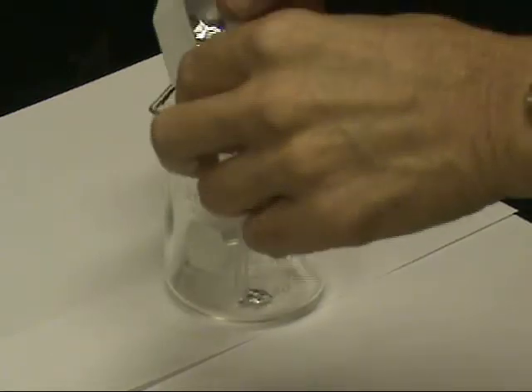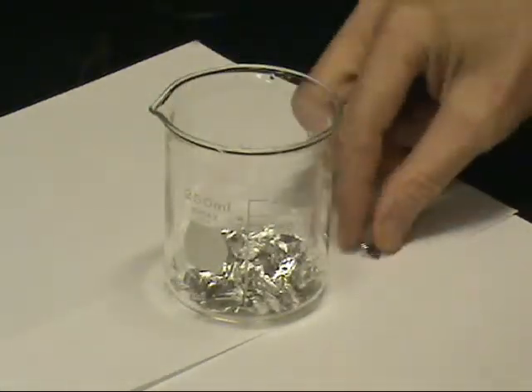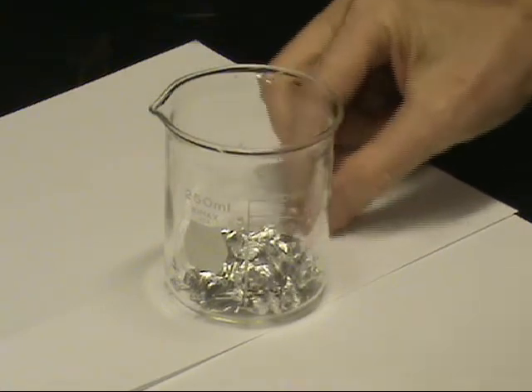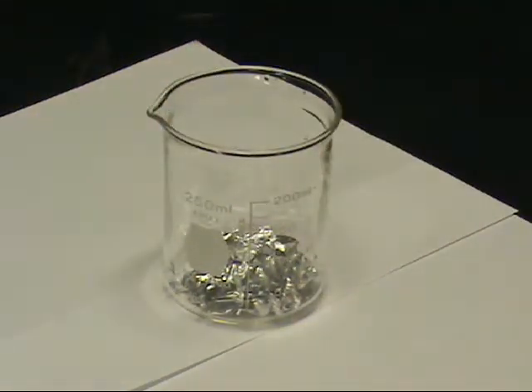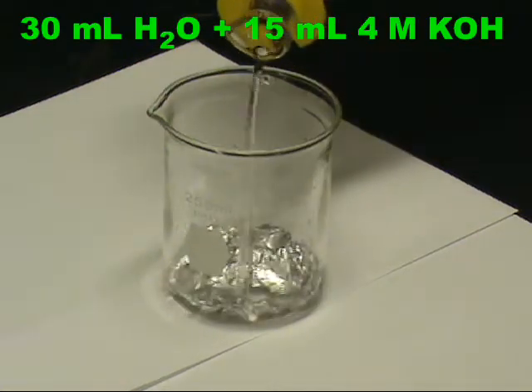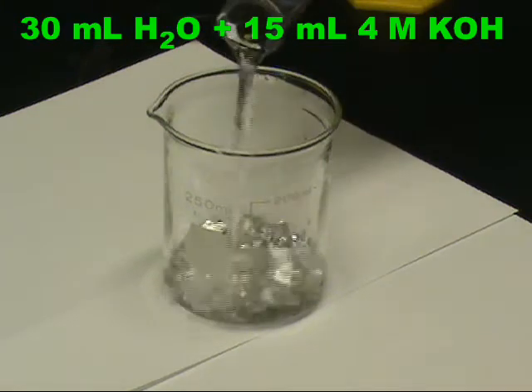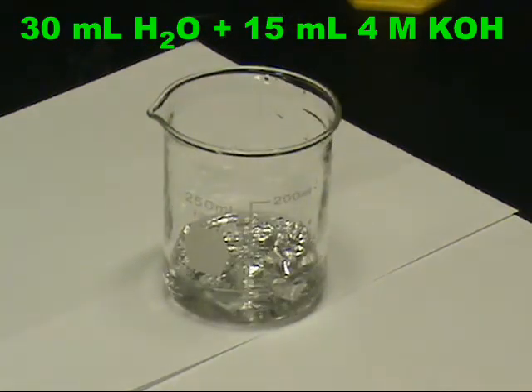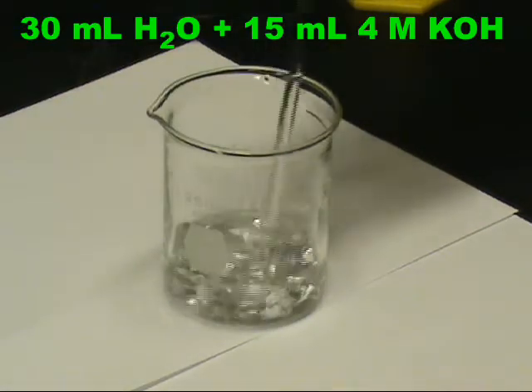Once weighed, the aluminum is transferred to a 250 milliliter beaker. Next, 15 milliliters of 4 molar potassium hydroxide and 30 milliliters of water are added. The solution is stirred with a glass stirring rod to be sure the aluminum is submerged.